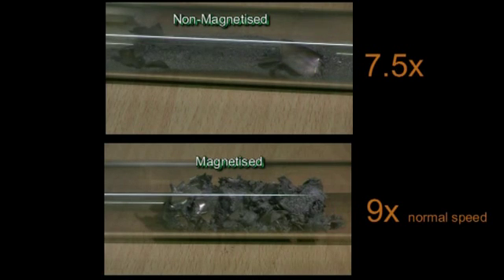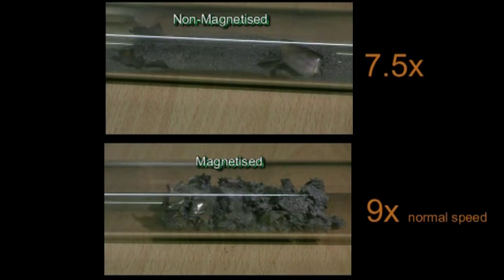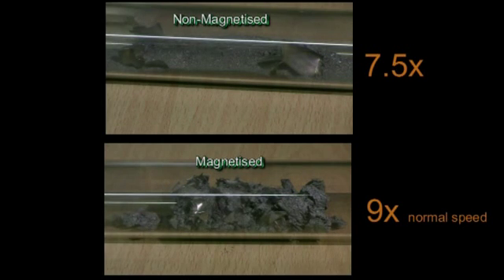Come towards the end of this video now, as both materials have almost fully reacted with hydrogen, and what we can see is that the material that was initially magnetised is starting to fall apart into smaller lumps, as the remaining material is losing its permanent magnetism.